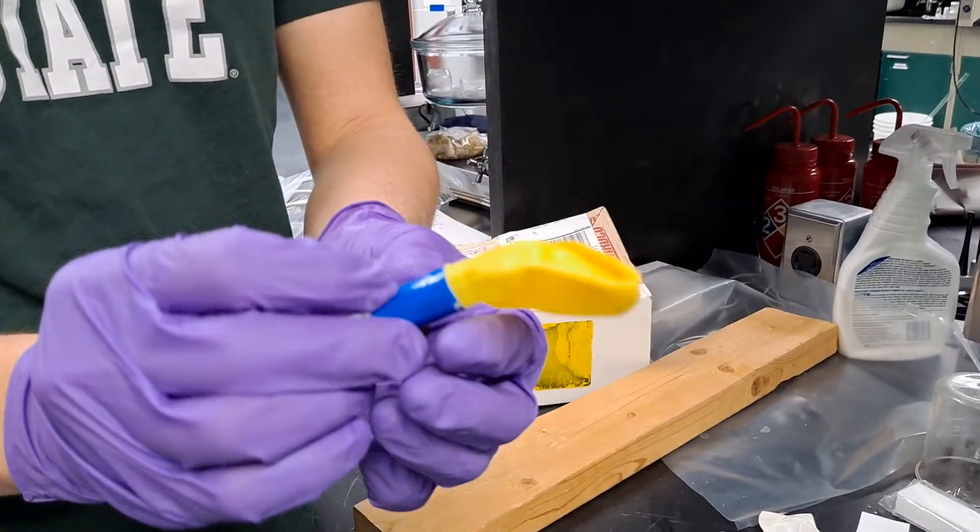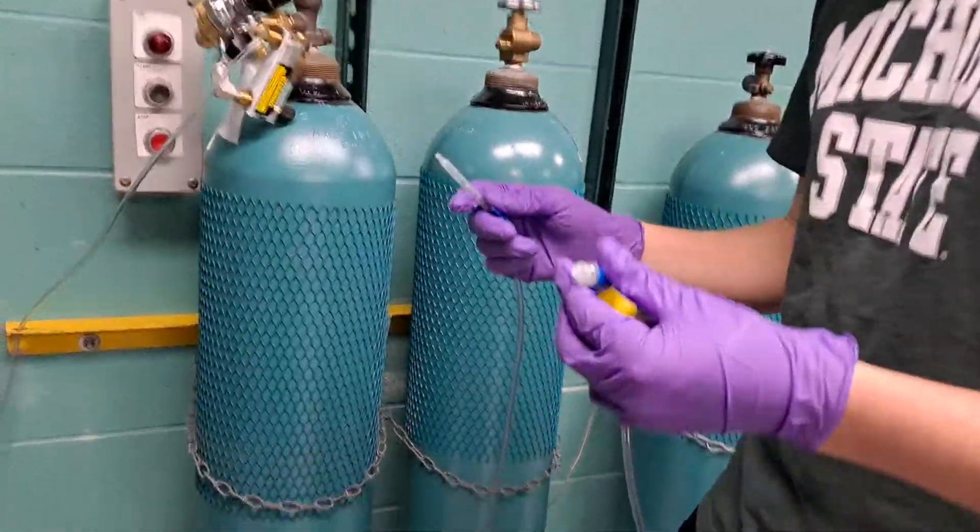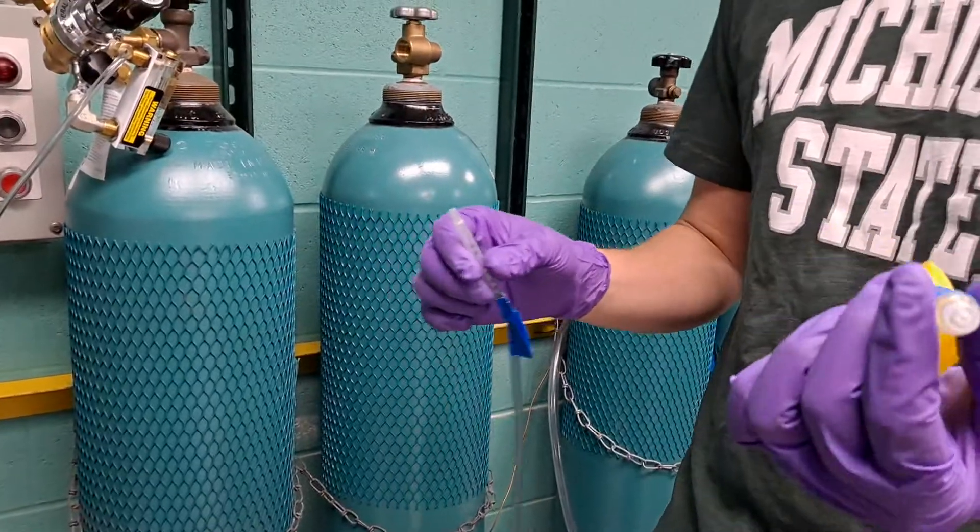And that is a nitrogen balloon. Okay, so now I'm going to show how to fill up the balloon with nitrogen gas.